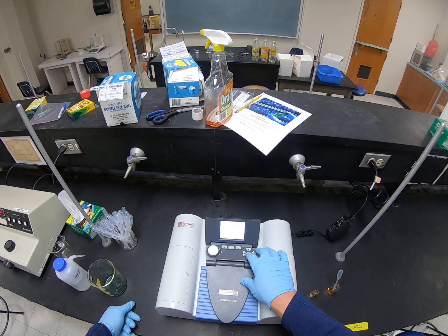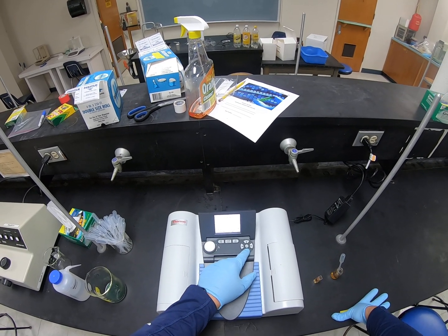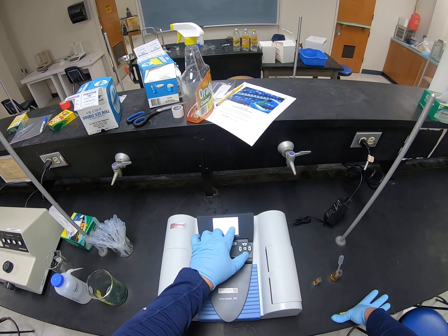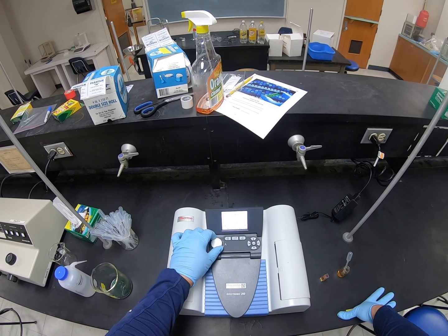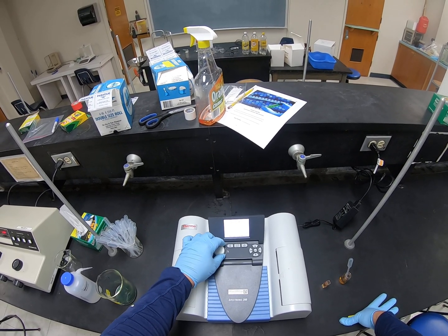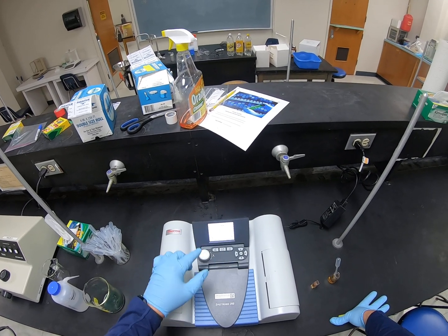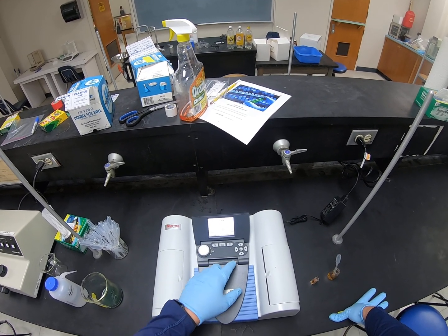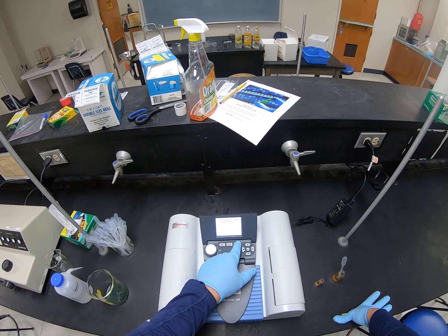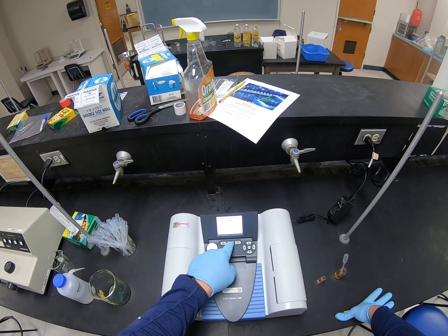So I'm going to see if I can look at the measurement associated with that. So it's pretty flat across here, but it looks like the absorbance that's showing at different points from 400 to 900 nanometers is pretty flat. There's not a major peak in here. And if I can remember how to zoom this out, so let me go to the enter, and I'm going to hit the 0 button.